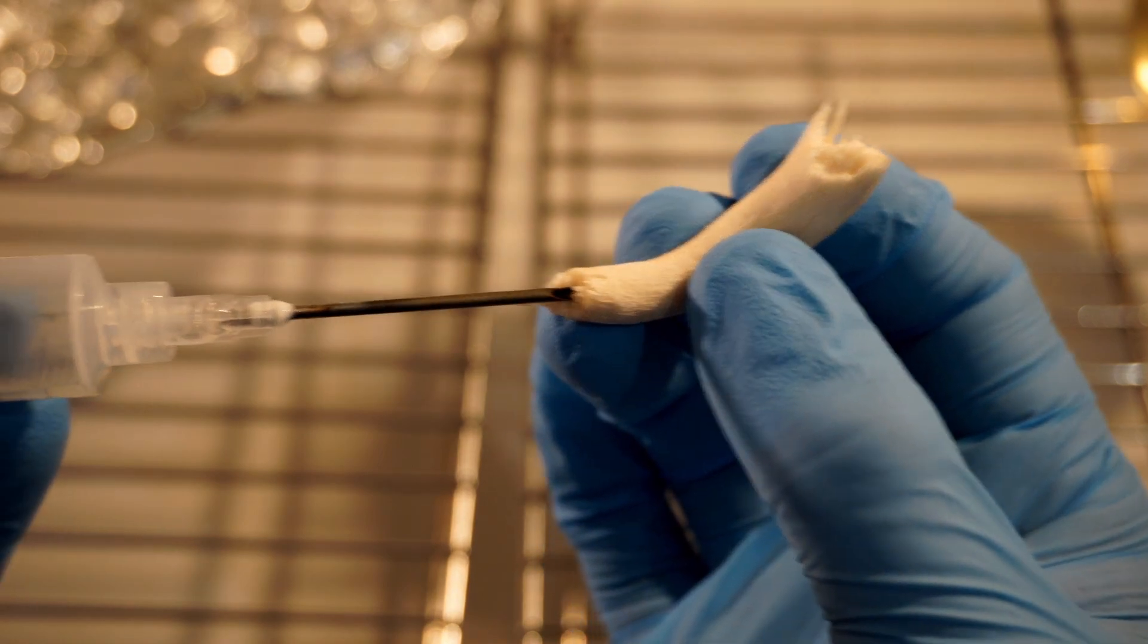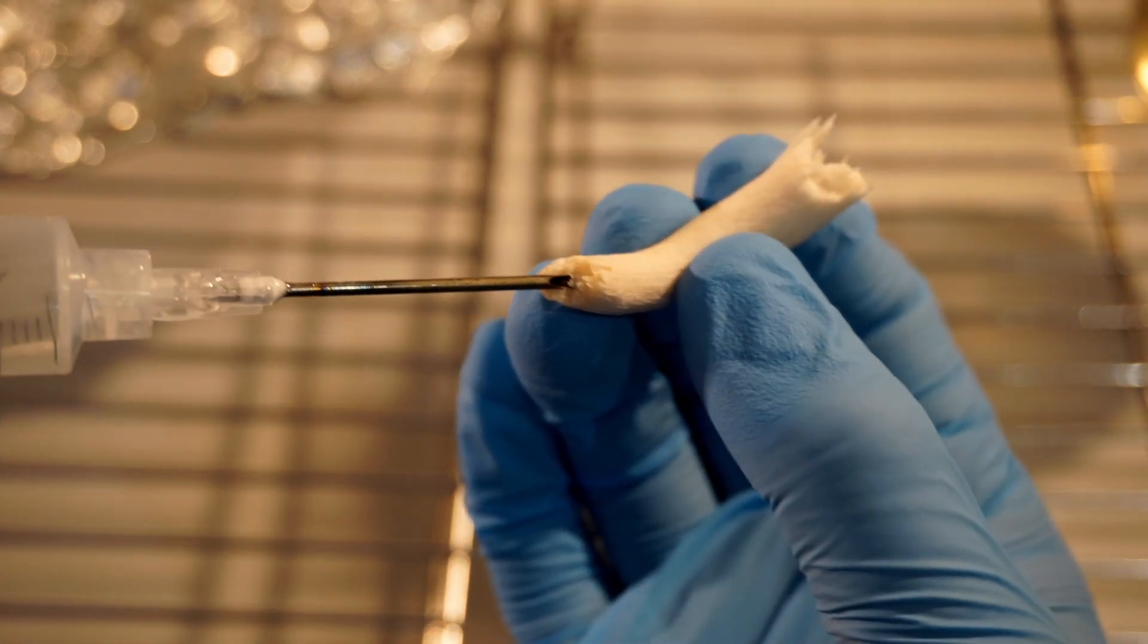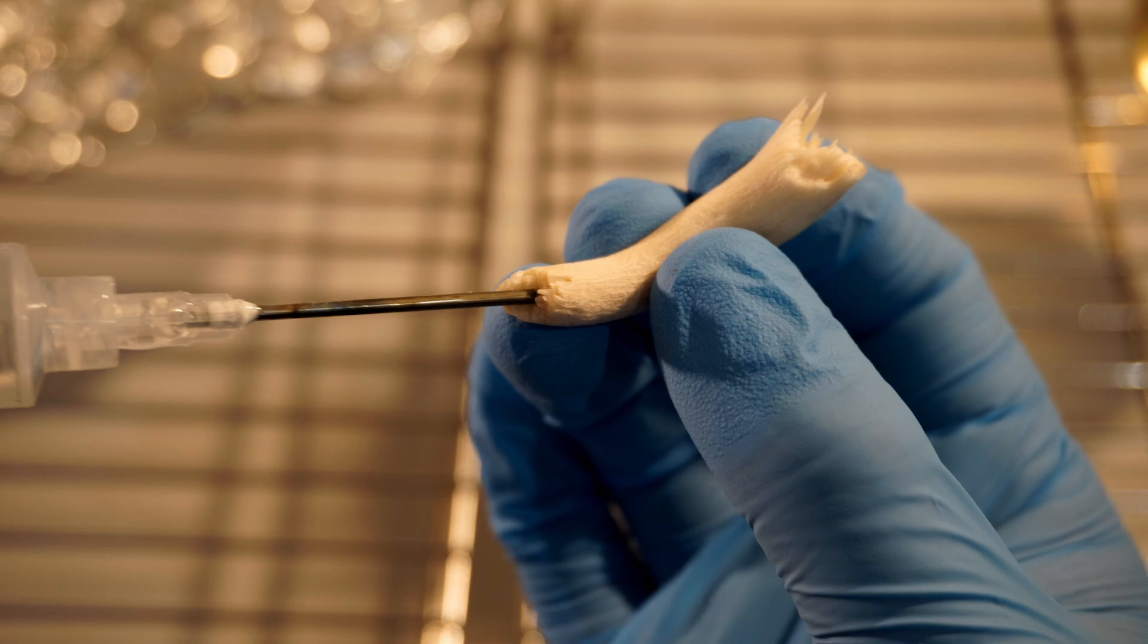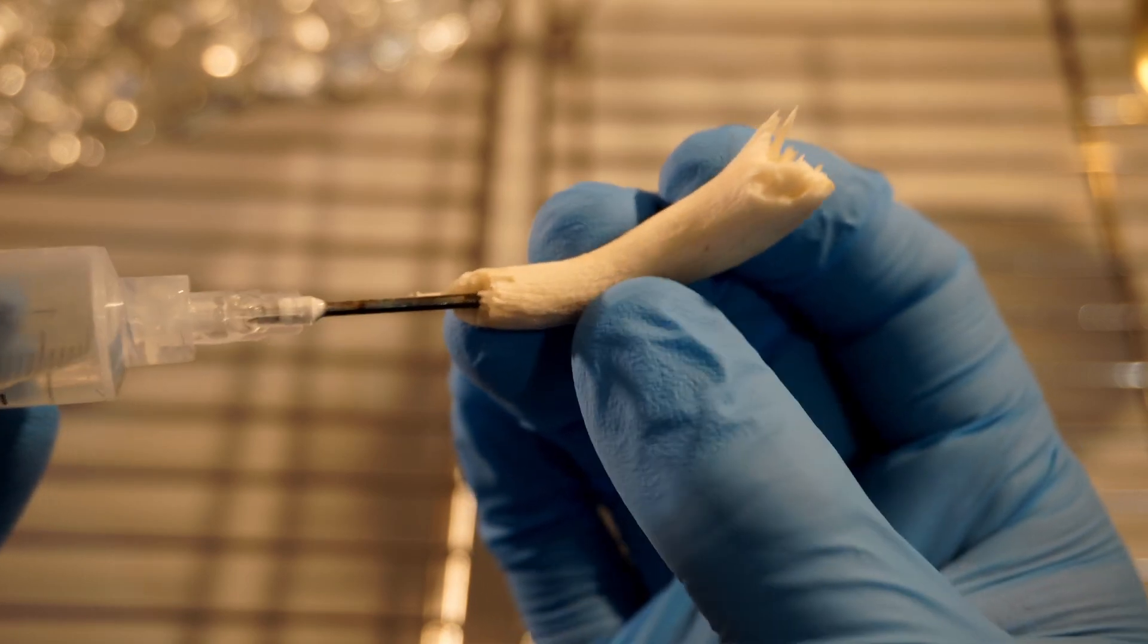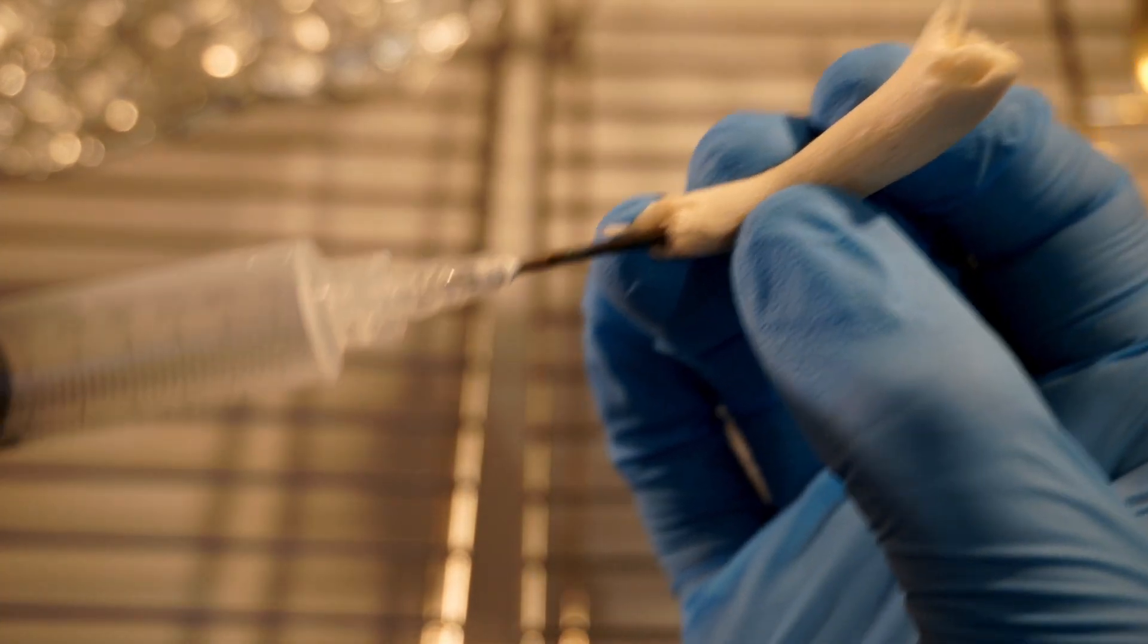Take your sterile syringe and then we're going to push it down the stem and what you want to do is get one of them filaments to go down into the hole.